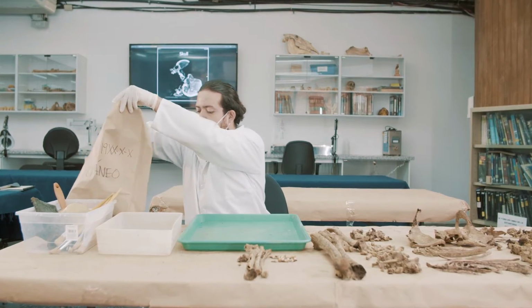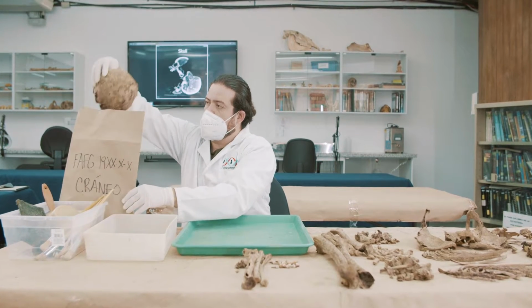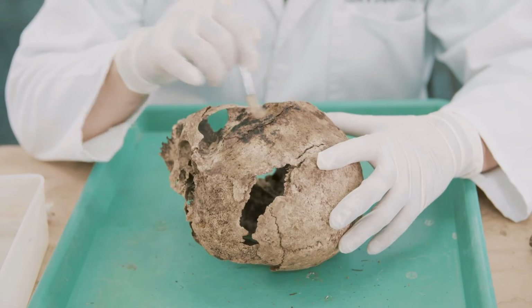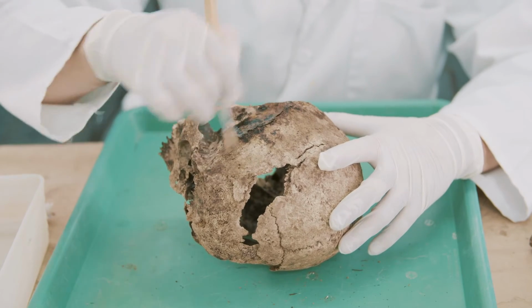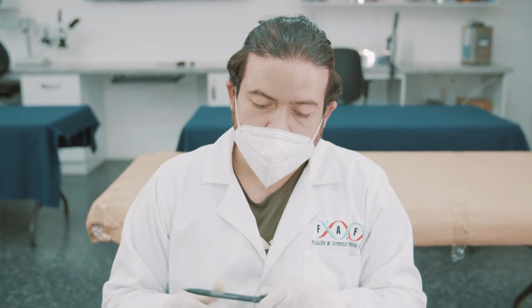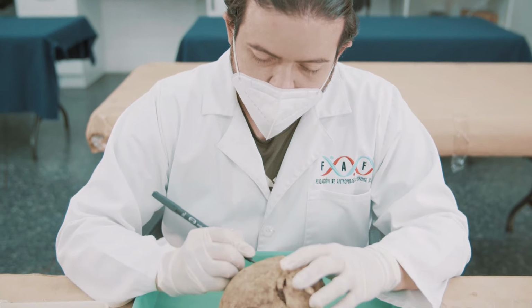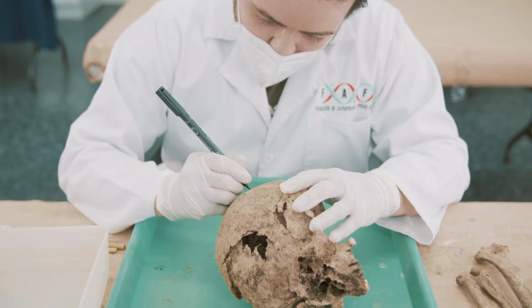Once the clothes are clean, the skeletal remains are gently washed with a brush and water, with the aim of removing as much soil and roots as possible. They shall be dry cleaned with a soft bristled brush to ensure their preservation and to avoid altering any signs of violence or individualizing features. Finally, the skeletal remains are labeled with a unique FAFG case number, a skeleton number, the grave where it was recorded, and a lot marker.